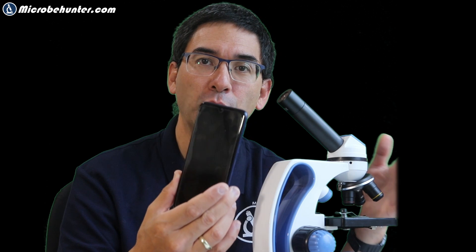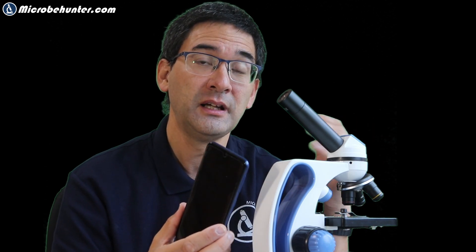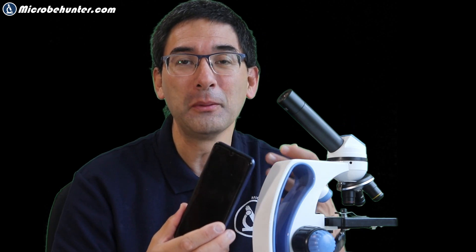I'm going to show you a possibility of how it actually works. The disadvantage of this method is that it's not suitable for video — individual pictures yes, but even this method will probably not allow you to hold it sufficiently steady to make longer videos. Short video clips might work.